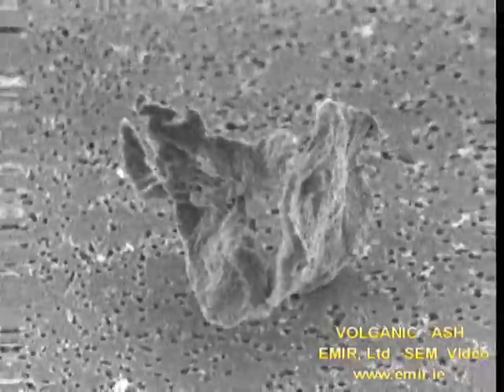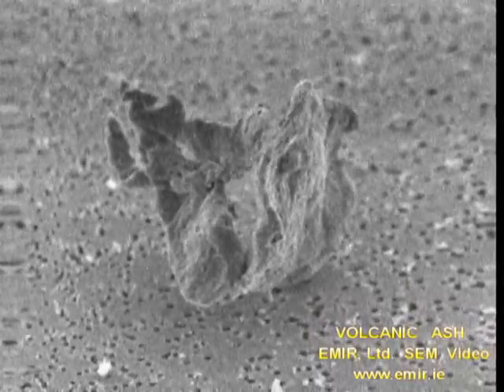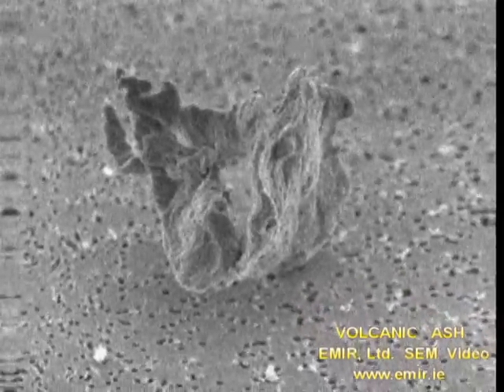Right now, you are looking at a single dust-sized speck of volcanic ash that floated from Iceland and landed in Ireland. This is what the ash looks like when seen under the high magnification of a scanning electron microscope, or sometimes called an SEM.